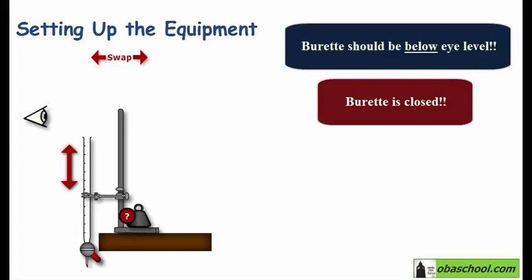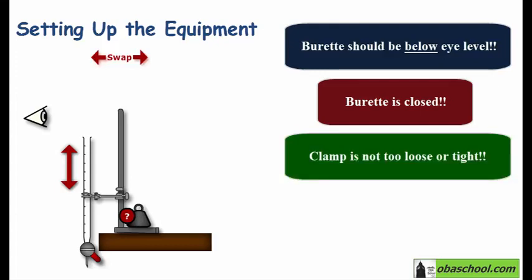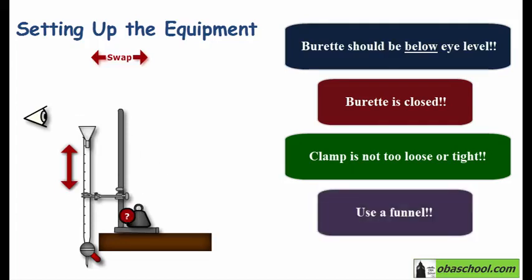Another thing that you should pay attention to is the clamp tightness. Make sure that it's not loose and not tight to avoid breaking the burette. And of course, you have to add a funnel at the top of the burette so that no solution is wasted. Let's try now filling the burette. So now we have filled the burette correctly.